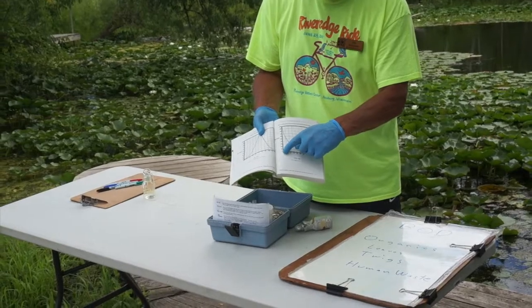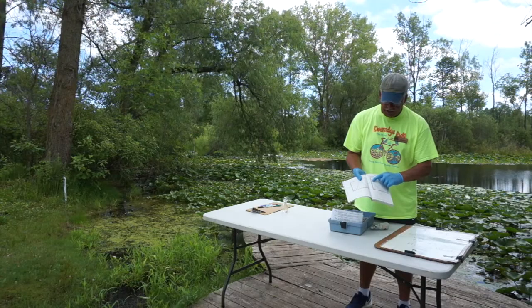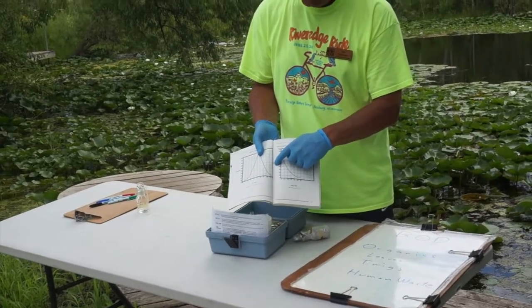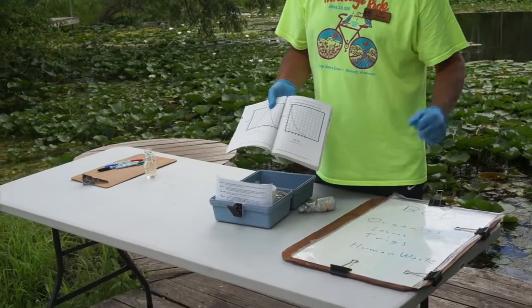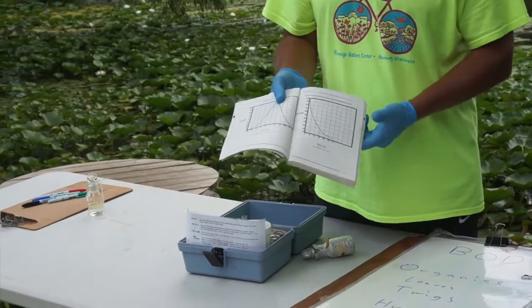Now, notice 0 to 5 is pretty narrow there, so you're going to have to do some guesstimating. Take a straight edge, run it up till it intersects with this line, run it across, and I would get a number somewhere between 80 and 70. That's a Q value. Again, it's like a test score. If you get between an 80 and a 70, you're probably looking at a C. In this particular case, that's probably maybe around a C or so, okay, something like that.